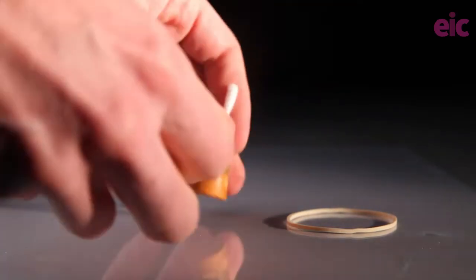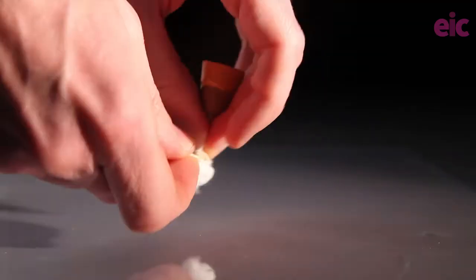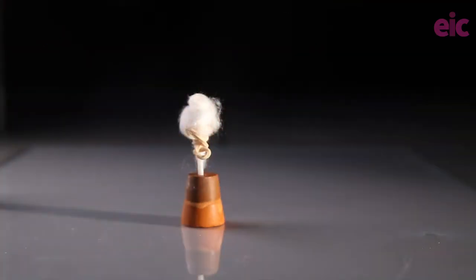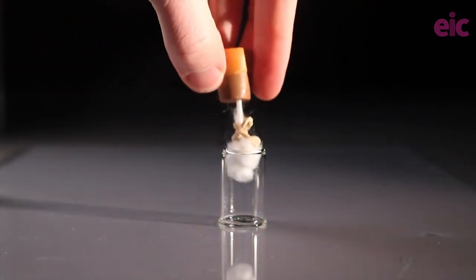So what you want to do is drill a hole inside the bung and then insert half a cotton bud and wrap a little bit of extra cotton wool around the end of it with an elastic band so that you can move each chemical to the tube and seal it all in one step.